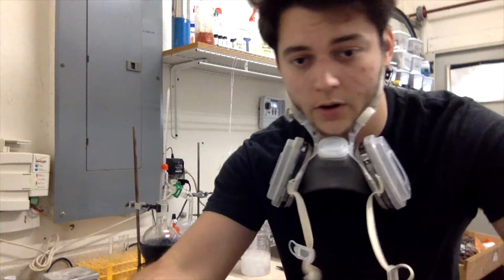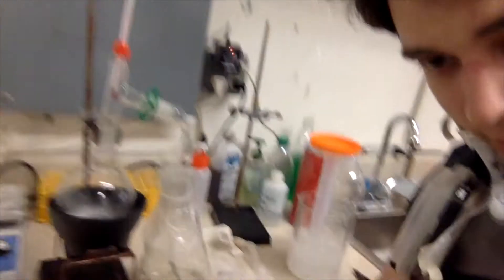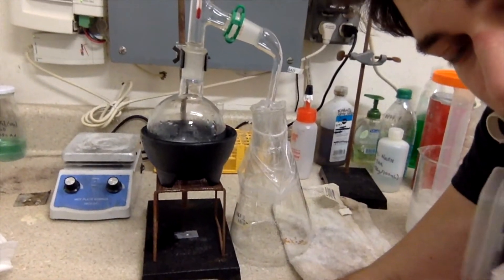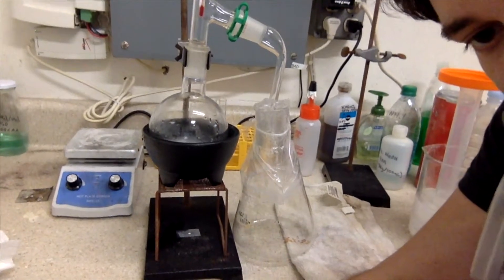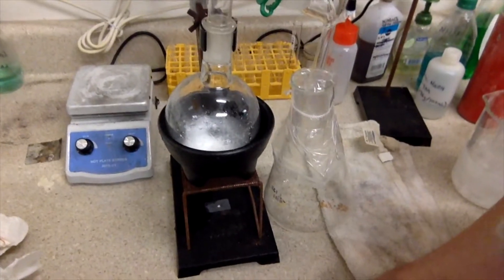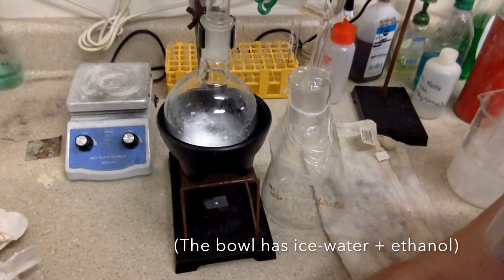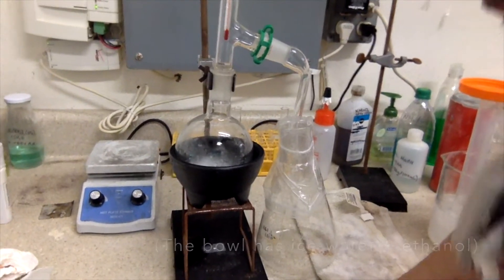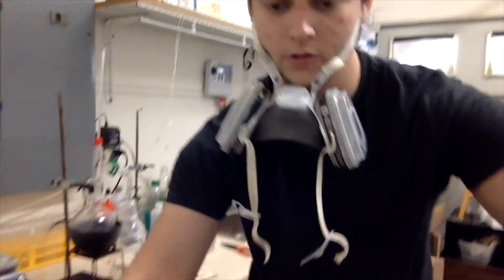So I got a new apparatus — actually it's old glassware, but that's what I'm going to use now. I'm just going to capture the gas in this flask. I've got seven grams of calcium hypochlorite, cold, sitting in that round bottom flask, and I'm going to pour cold hydrochloric acid into it because that will slow the reaction down.